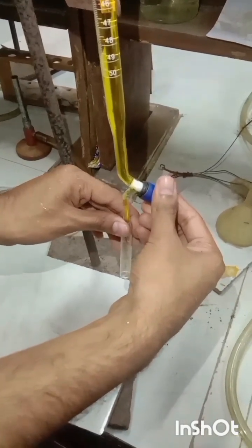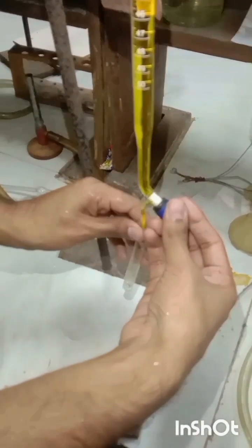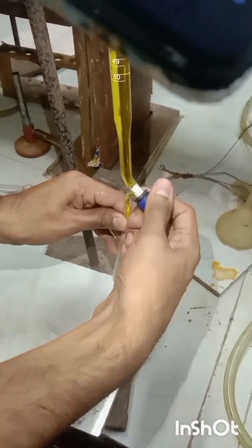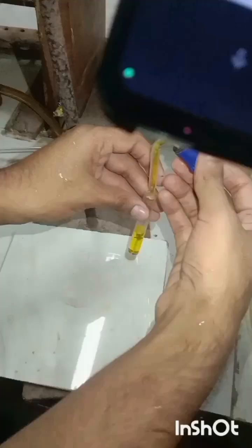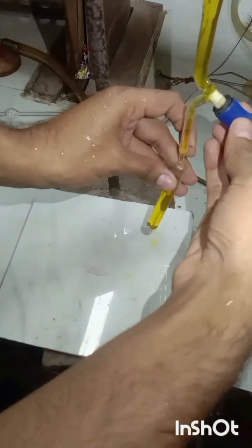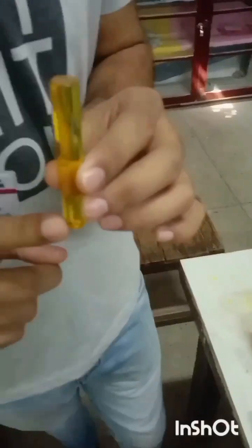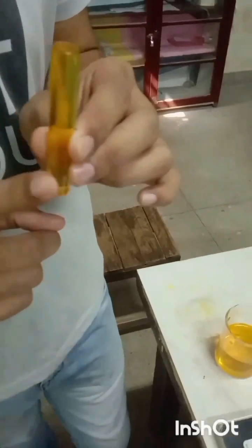Now we have to prepare solutions in test tubes — four solutions in four test tubes respectively. The first solution is 0 ml potassium dichromate and 10 ml water. The second is 2 ml potassium dichromate in 8 ml water. The third is 4 ml potassium dichromate in 6 ml water. The fourth is 8 ml potassium dichromate in 2 ml water. And finally the pure potassium dichromate solution with 0 ml water.